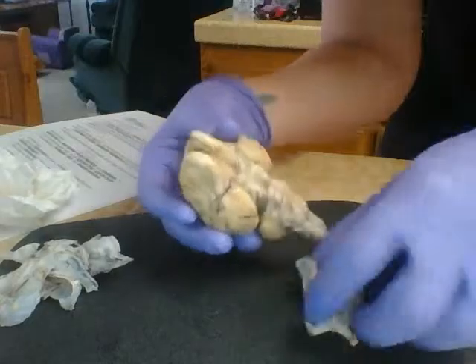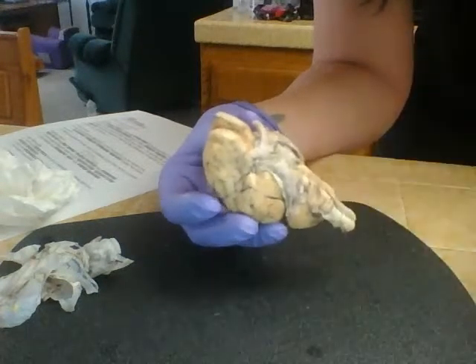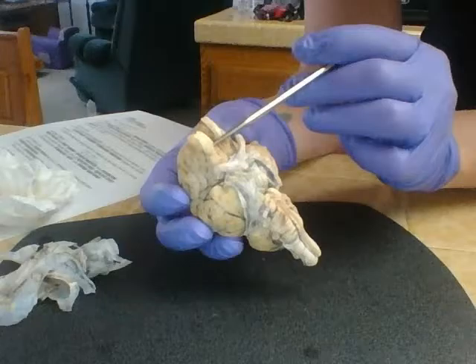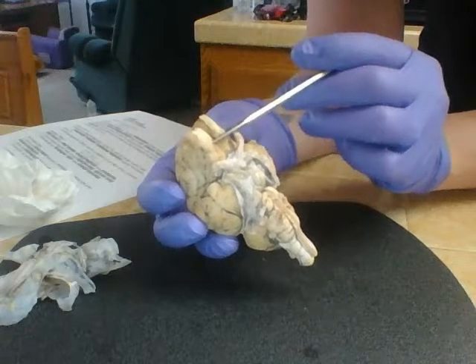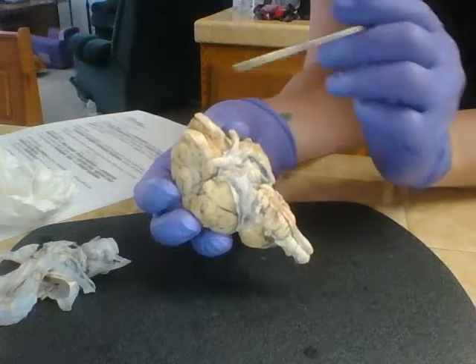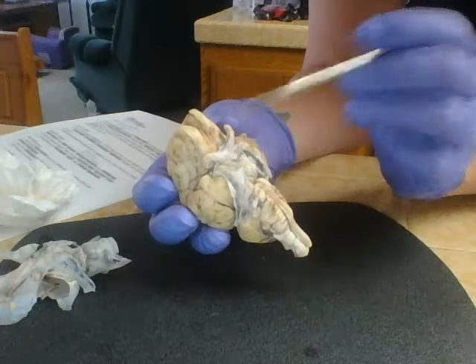So now we're going to look at the ventral aspect of the brain, which is kind of like the front. Now, as I was taking the meninges off previously, these little guys kind of popped off with it, so I'm going to stick them back in place. So as we're going through the ventral portion, we have the optic nerves, and olfactory bulbs that stick out here, and olfactory has to do with our sense of smell, so these would come out to the nose and aid in that sense of smell. And we have the olfactory tracts that run back down to the brain.